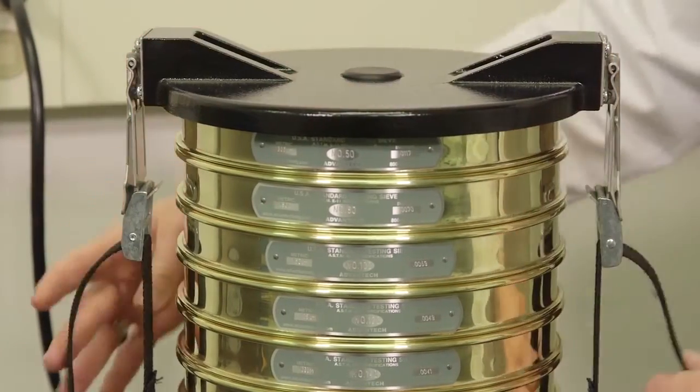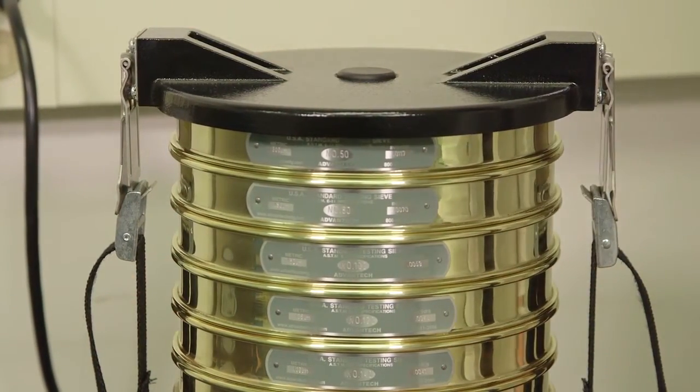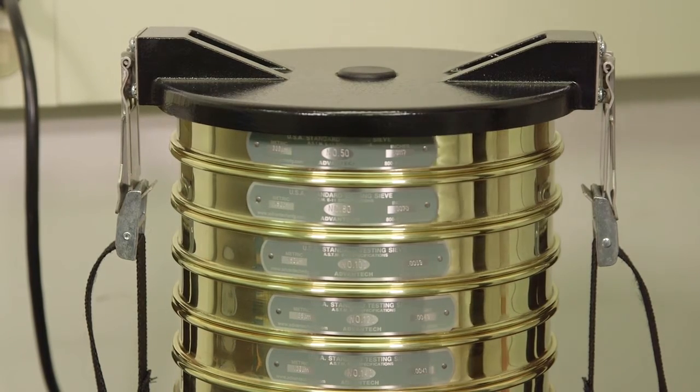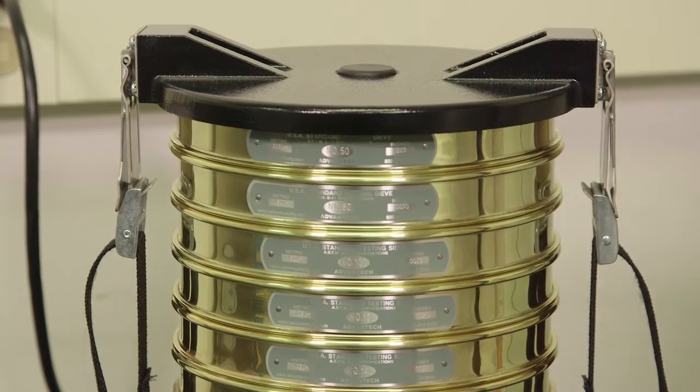Press both levers down closing the clamping latches to secure the stack. Do not use excessive force. Never run the machine with unsecured sieves.